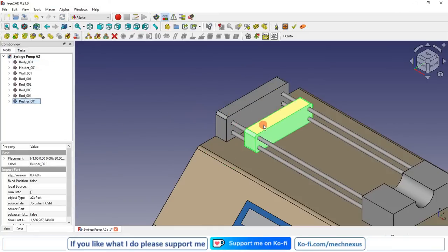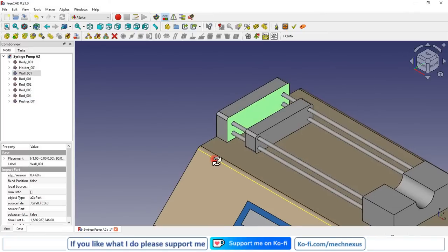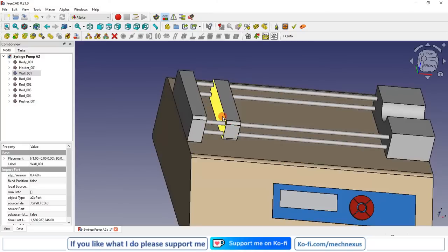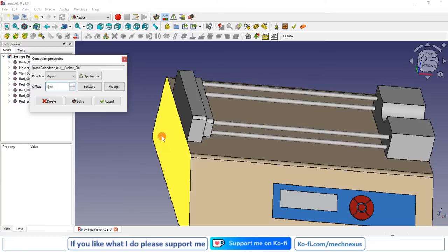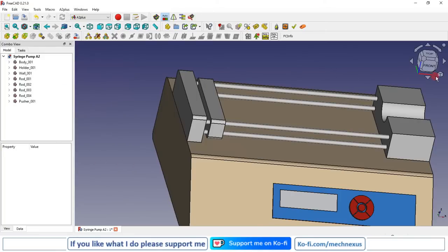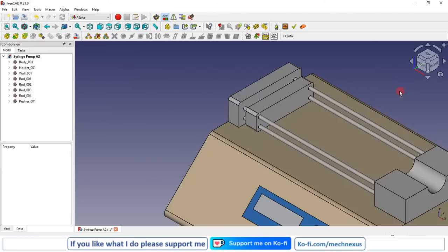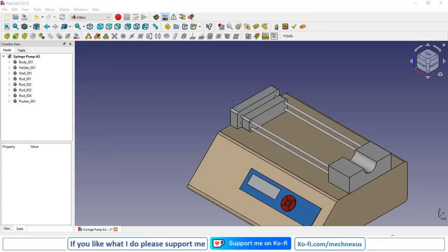Now I will give the distance constraint between these two. Now I will select this face and this face, and I will give the plane coincidence constraint and I will give distance 4.29. I will give it minus and I will accept it. Now we will move to the next step.